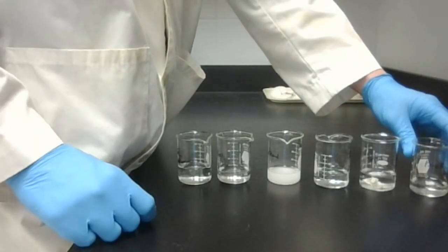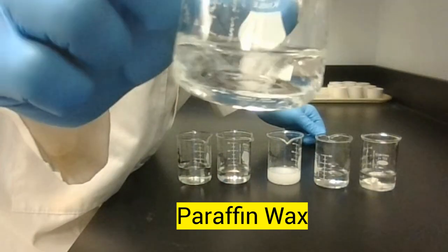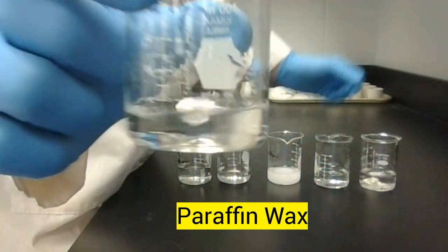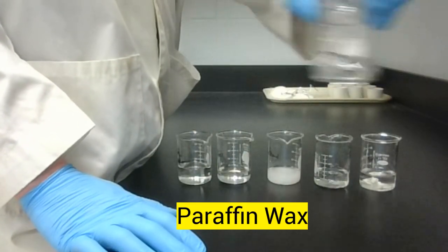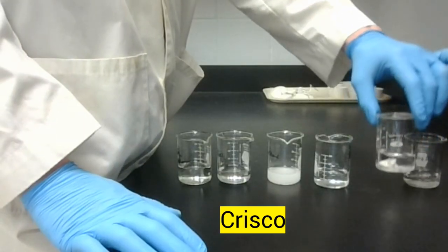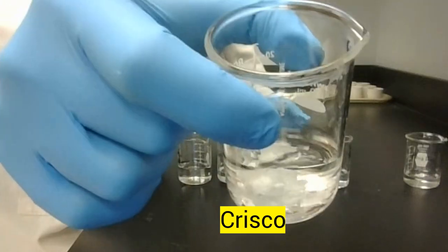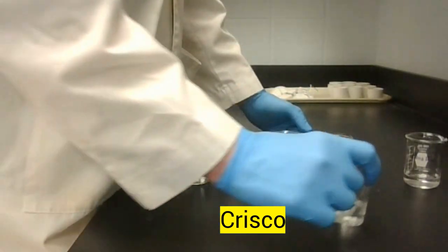And now I have my results after a minute of swirling. We can see the paraffin wax did not dissolve. There's still a huge chunk of it there at the bottom. It did effectively nothing. Paraffin wax, we'd say, is insoluble. Does not dissolve. The Crisco, likewise. Crisco, the old lump there on the bottom, did nothing. It did not dissolve. It is insoluble.